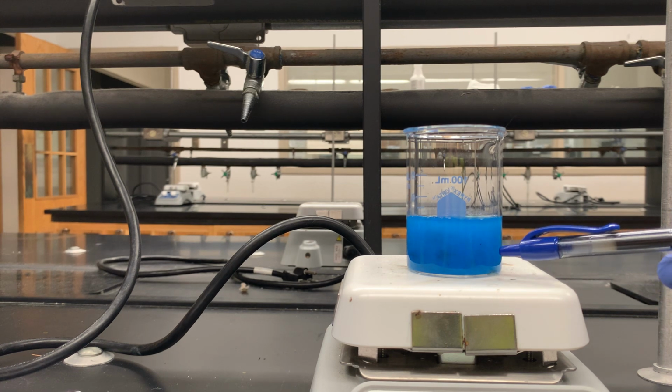And you can see that copper containing solid, maybe there's little black speckles of it. And look, it's kind of popping up there, continuing to stir. You want to see that. And you know, I'm kind of on a fine line between adjusting my stirrer hotter and not too hot sort of thing. Okay.